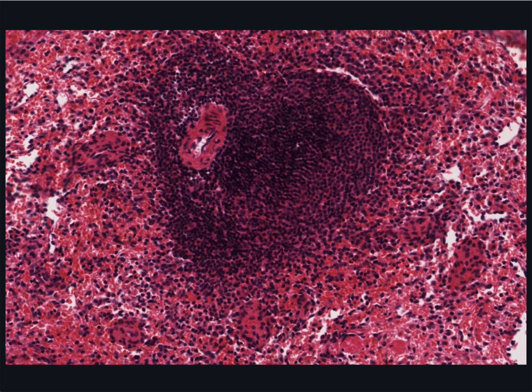So here is a central artery cut a bit obliquely, and here is the lumen with an endothelium or tunica intima, and then 1 or 2 layers of smooth muscle making up the tunica media. All this dense collection of lymphocytes, or white pulp, is the tunica adventitia.